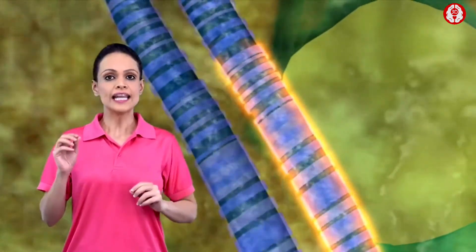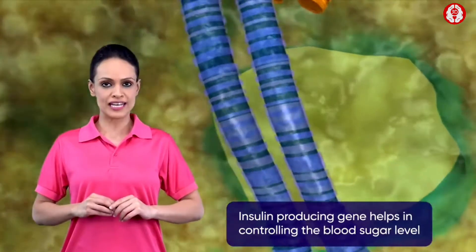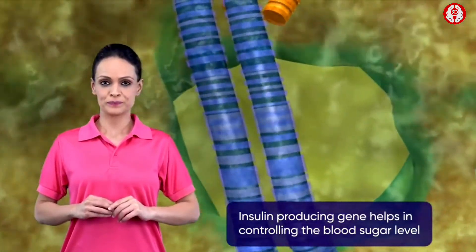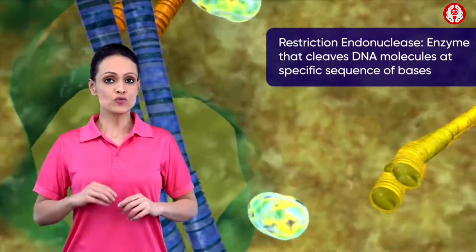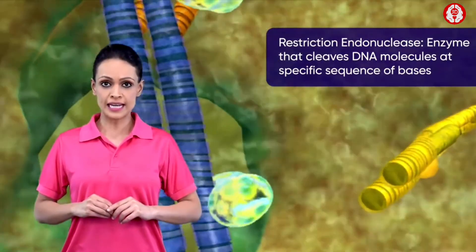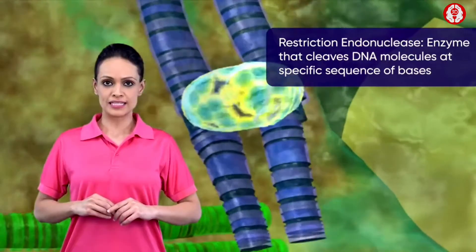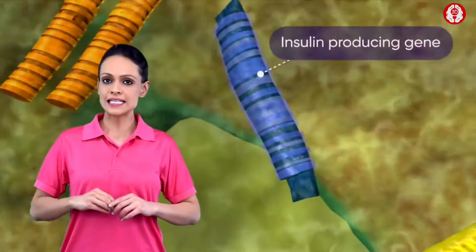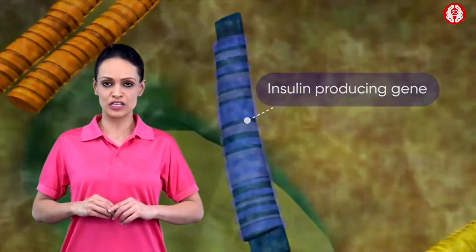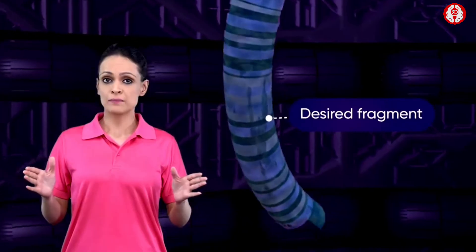The chromosome has specific regions that are responsible for encoding particular proteins, called genes. One such gene produces the protein insulin, which helps in controlling the blood sugar level. The identified gene is then treated with the DNA-cutting enzyme called restriction endonuclease.